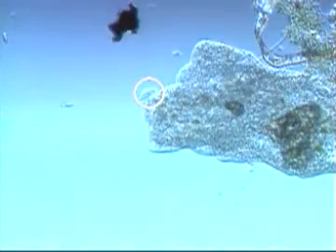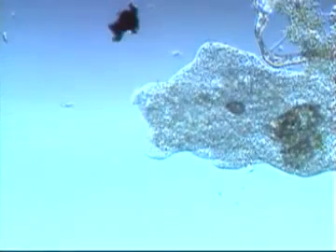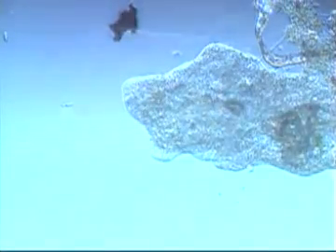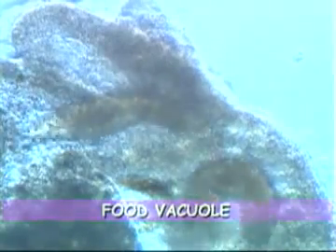Some organisms, like this tiny protozoan, appear to be attracted to amoebas, hoping to feed on their contents, but frequently end up being swallowed themselves. If you examine an amoeba's cytoplasm, you will often find still living organisms struggling within it. An amoeba forms a bubble called a food vacuole around its food. The food, in this case a paramecium, is then digested within the vacuole.